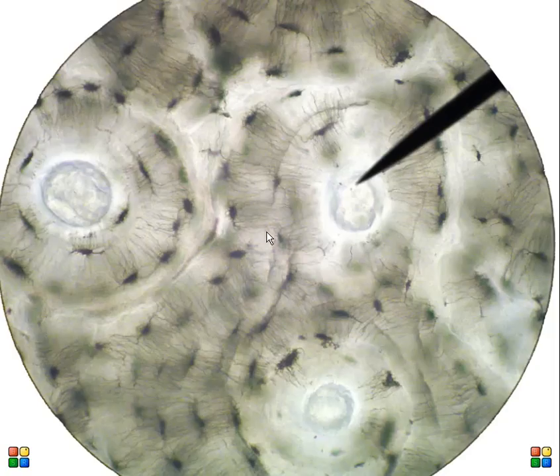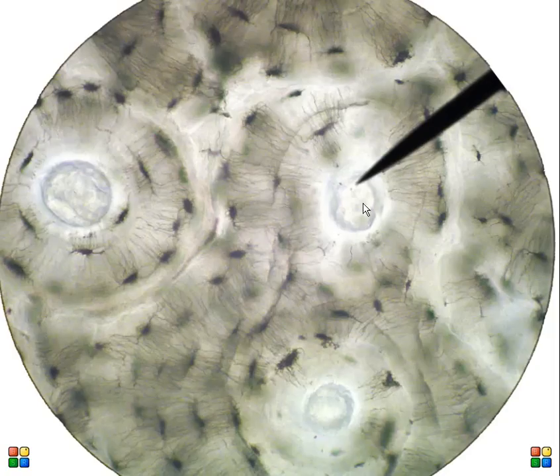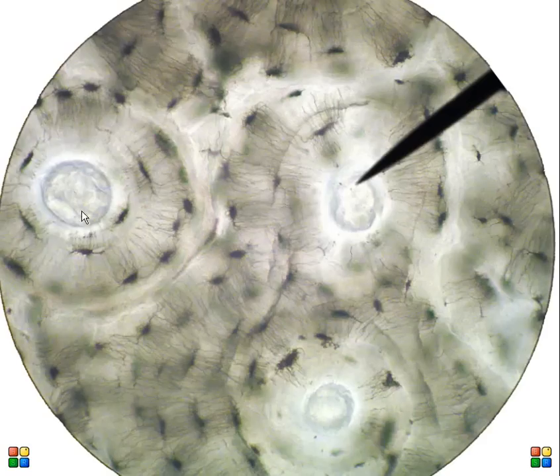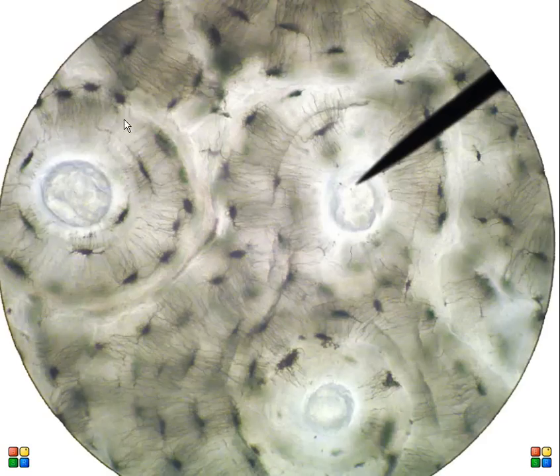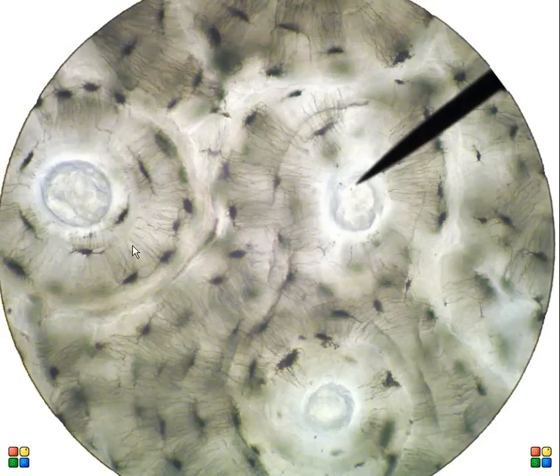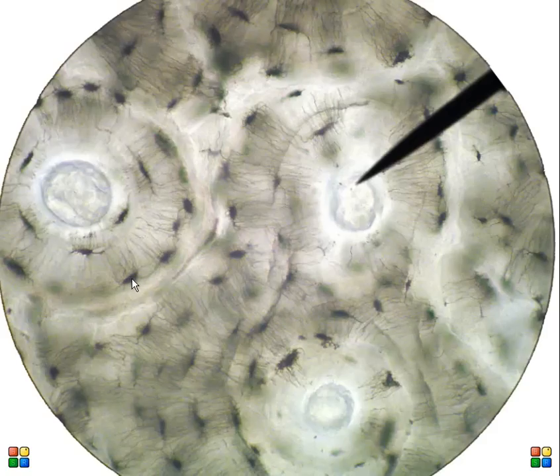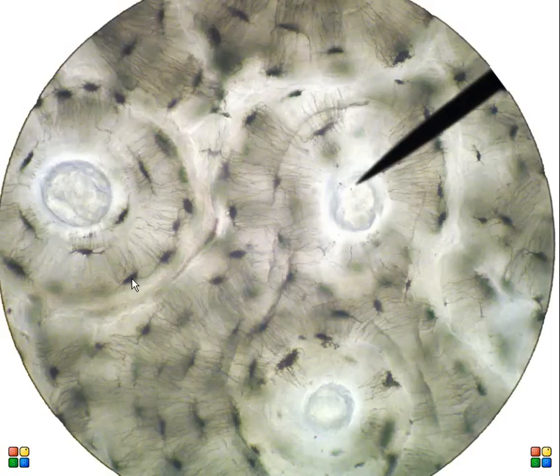Let's go to the highest magnification I have — this is 450 times magnification. Again, central canal, central canal, and central canal. The layers are called lamellae. The compartments here are called lacuna or lacunae, and the cells inside of them would be osteocytes.